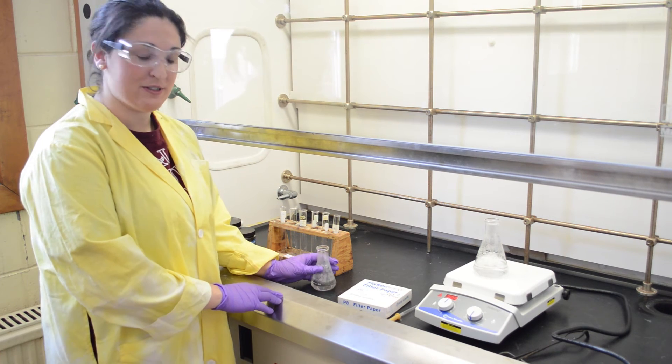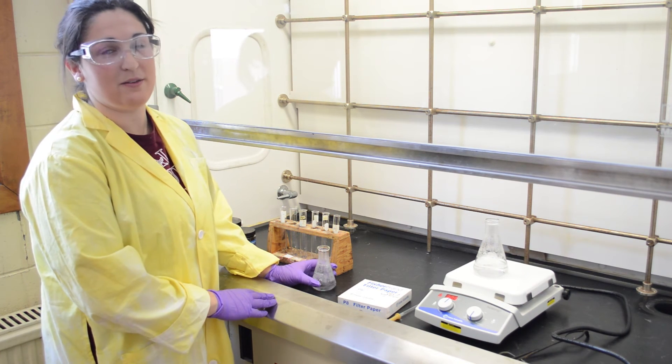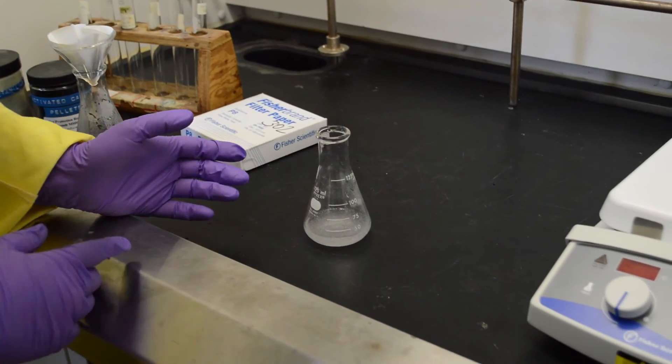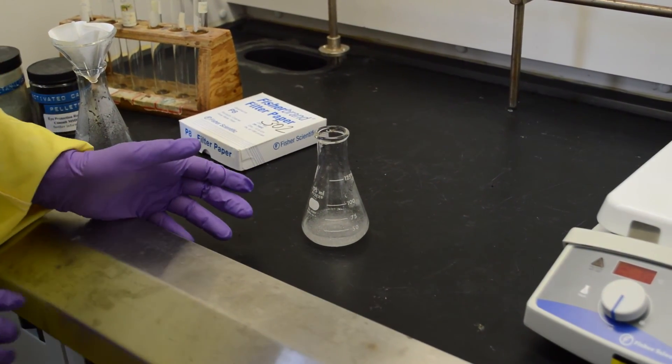Now leave the solution to cool to room temperature, and then further recrystallize using an ice bath. As you can see, we got crystals from our product just by leaving it at room temperature.